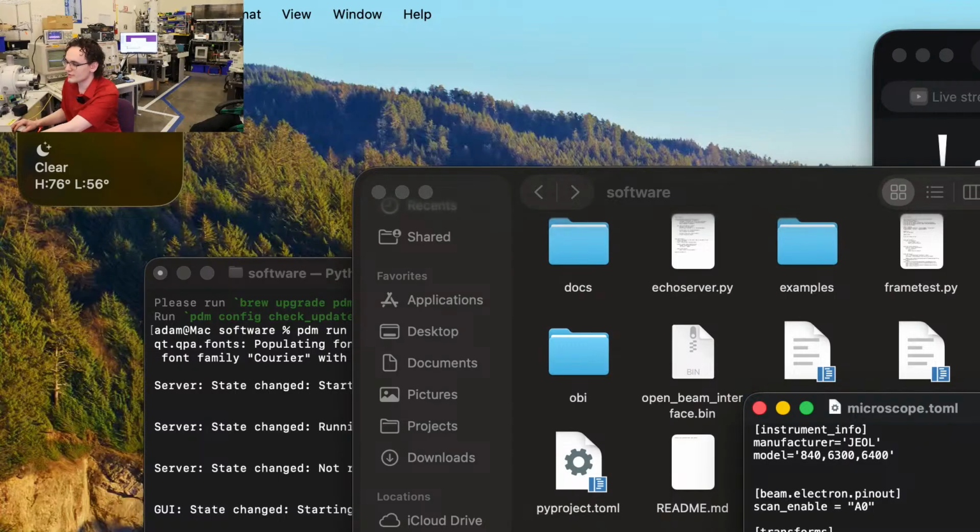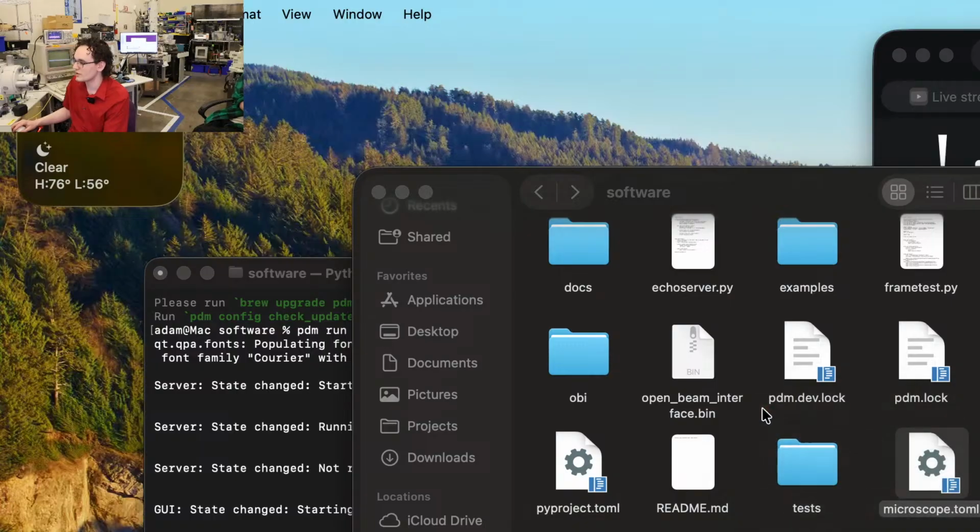And then we have our transforms and our rotates. So our transforms and our rotate basically flips the signals around because on some microscopes, the top left corner of the screen is positive voltage and the top is a positive voltage in X and Y. And on some microscopes it's a negative voltage in X and Y. So that's why we have the rotates and the flips. And then we've also got a delay. So this is how long it waits to start scanning after the relay flips. So these are settings we found to work really well for this particular microscope. So we're going to go with that.